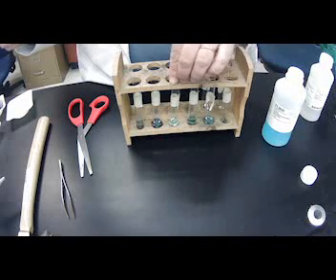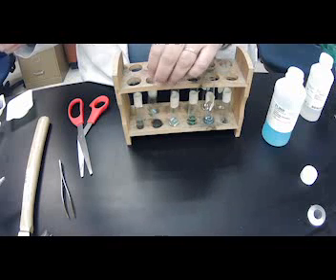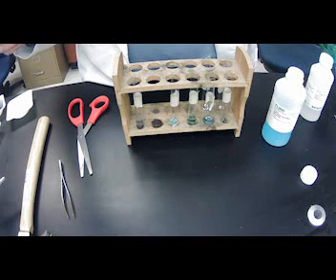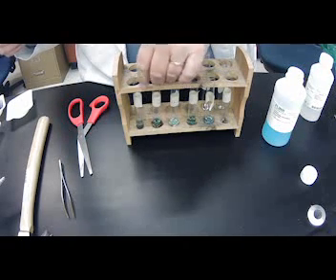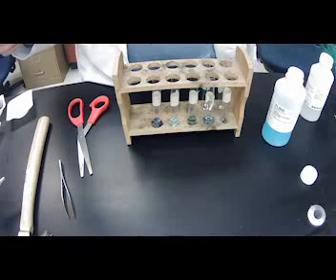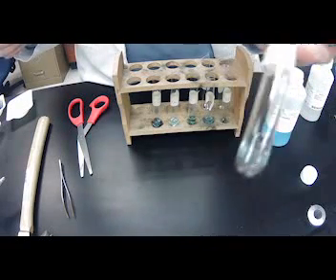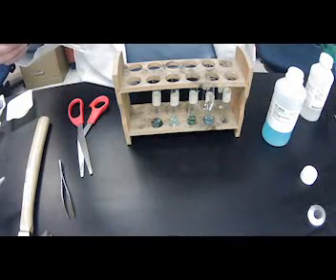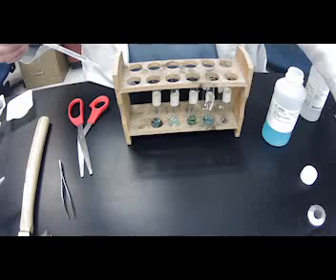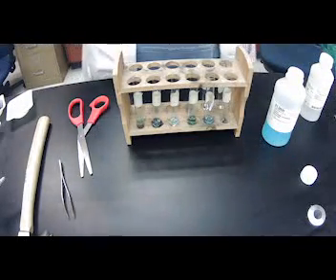Sorry, I'm going to go back and actually listen to the rest of them. Nope, no bubbles yet. Nope, just ringing. It's knocking around there. There is a reaction with aluminum. Now we can see this reaction. I thought there would be reaction with aluminum. Aluminum is actually turning like a dark brown, and it has bubbles. I don't know if you can hear it. Aluminum is reacting with copper chloride.